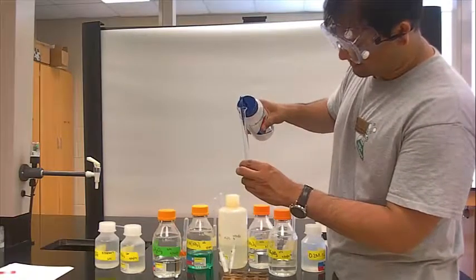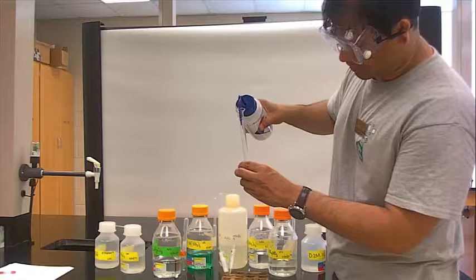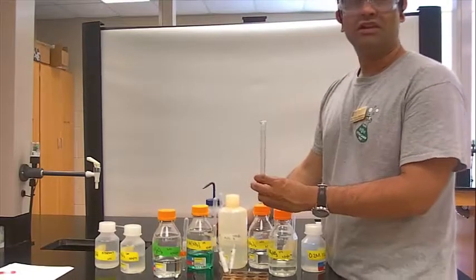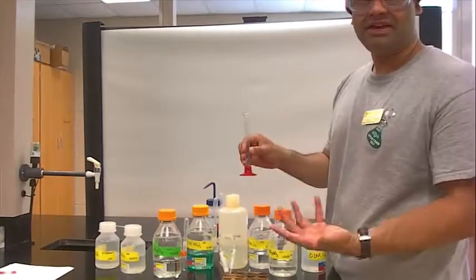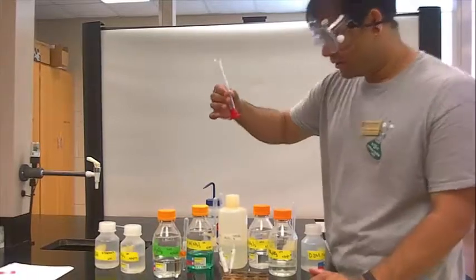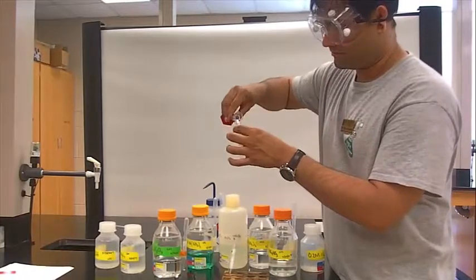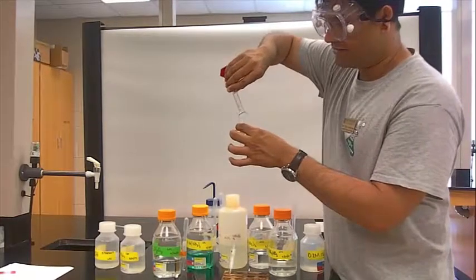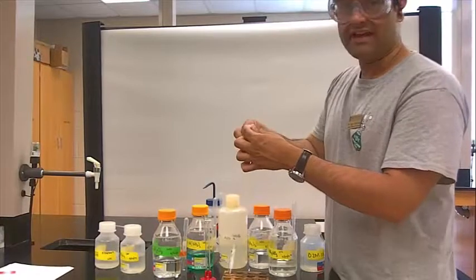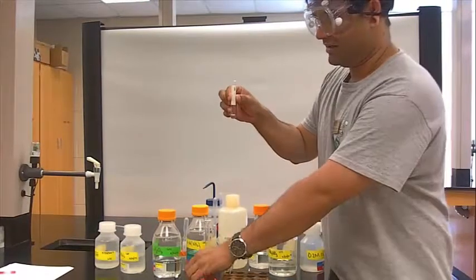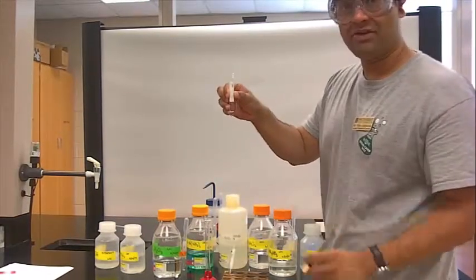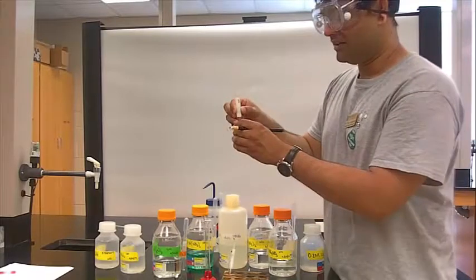Since this is qualitative instead of quantitative, we don't really have to concern ourselves being so analytic. This is about one mil. I'll pour it here, and this is just water. I'm trying to set the one mil mark. That is about one mil. If you have a Sharpie, bring it to the lab.